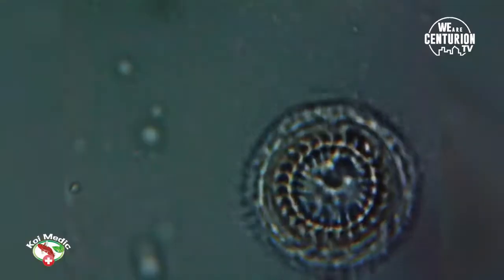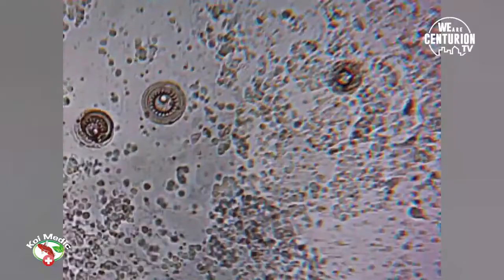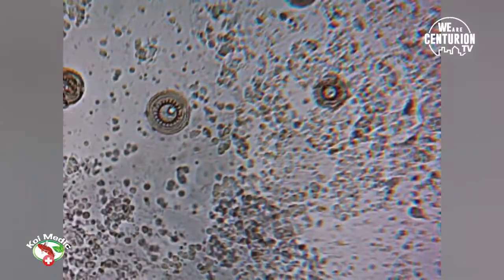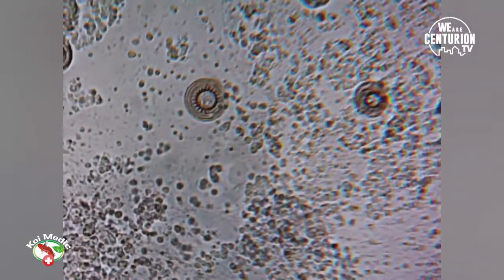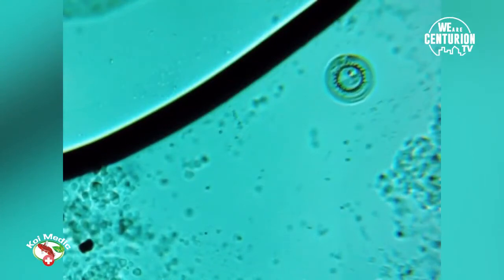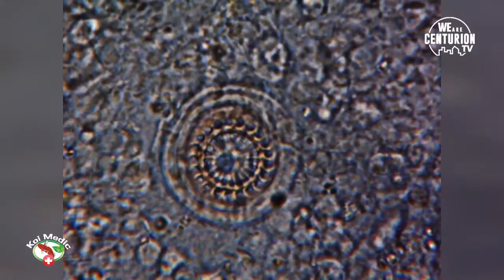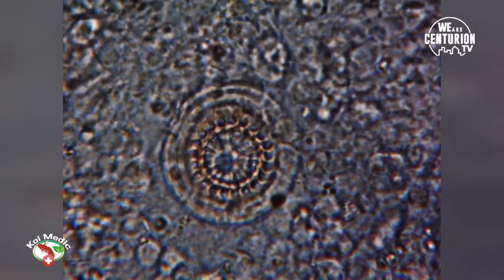I've got the microscope here and I've just spotted a parasite. I'm not going to tell you what parasite it is — when you see the film clip, I'd like you to see if you can identify it, and then I'll tell you later. Let's have a look.